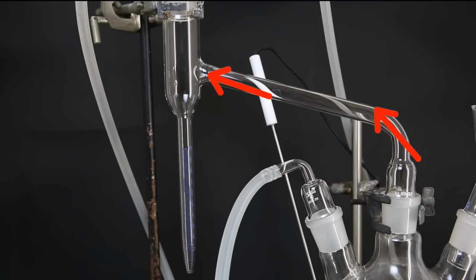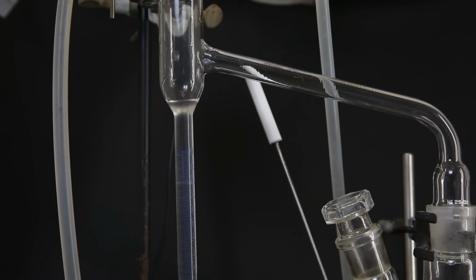The solvent, in this case toluene, will form an azeotrope with water, which means they will boil off together at the same temperature in a certain ratio. So the condenser above the trap will condense the vapors of the azeotrope, which will flow down into the lower part of the trap. Because water is denser than toluene, the water will sink to the bottom and collect there. Since the top layer is toluene and toluene is constantly being added to the trap, it can overflow back into the reaction flask, and this way the volume of toluene in the reaction flask stays mostly the same.